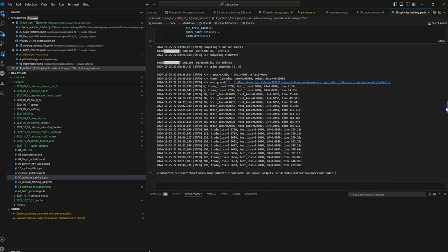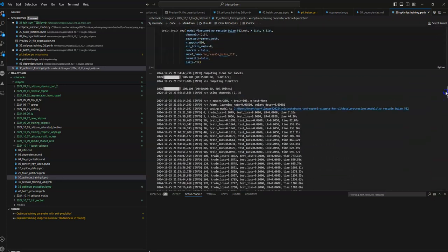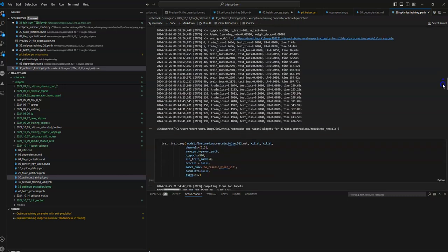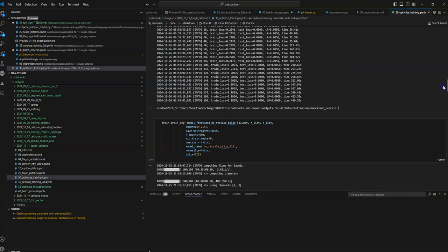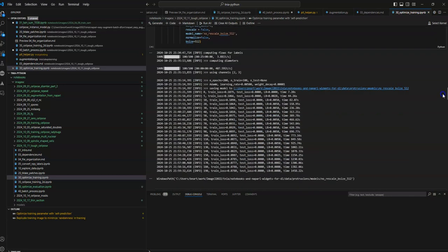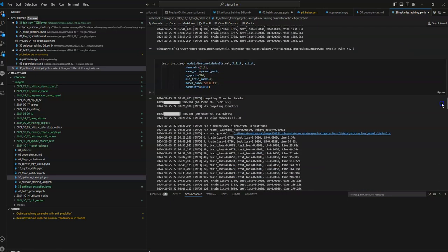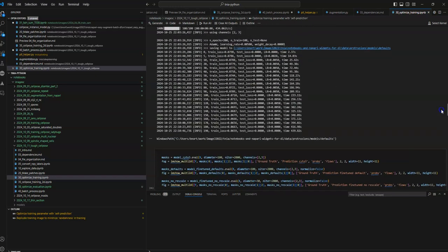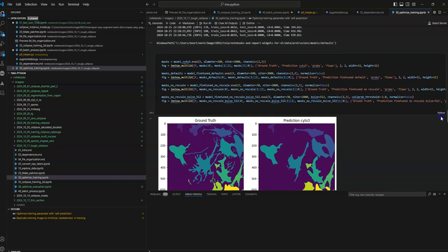But the rescale is still probably important. So I train a couple of different models, varying the settings a little bit. The goal here is to try to get a perfect answer, because I'm then going to test it on the same one image I trained on. So here I go through a few of these.